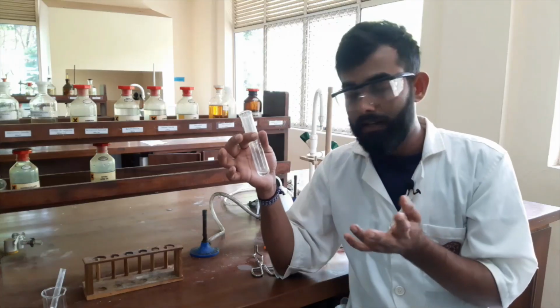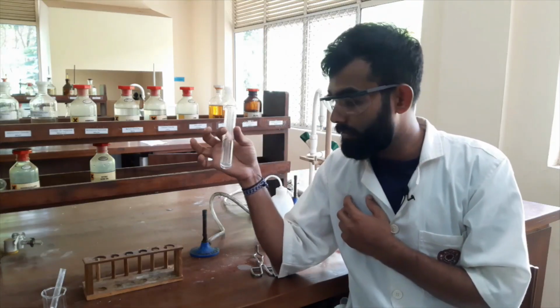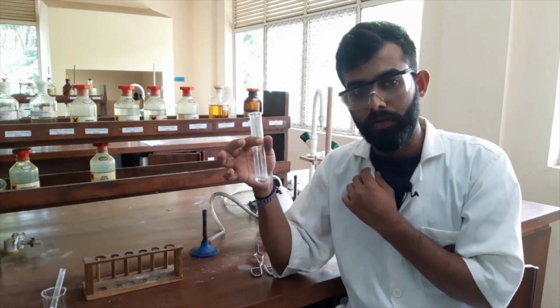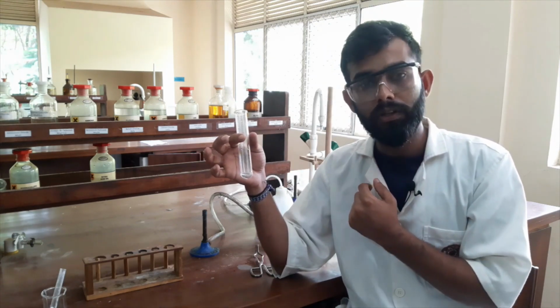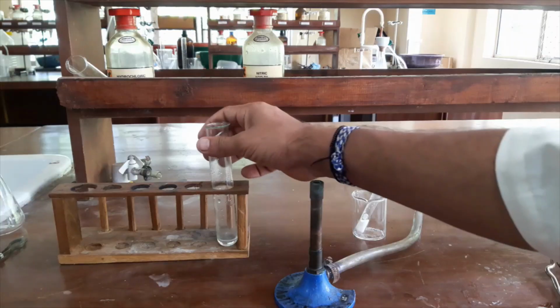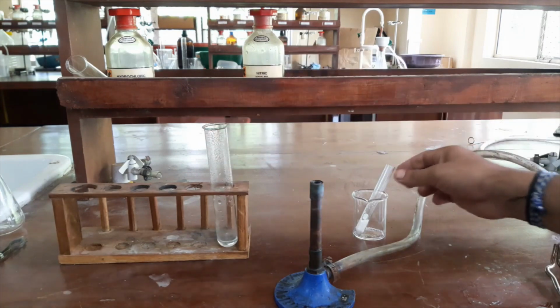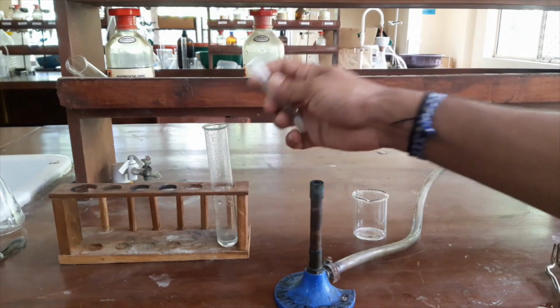We will do that. First of all, I have to dissolve my chemical in this boiling tube. You have to come and look very carefully. Here, to this boiling tube, I will add my whole sample.